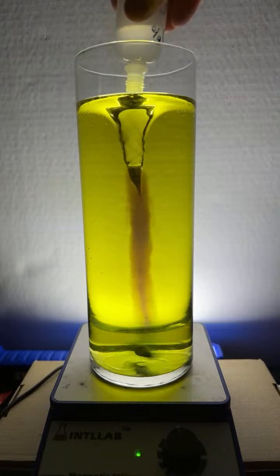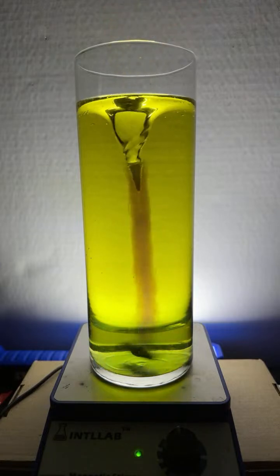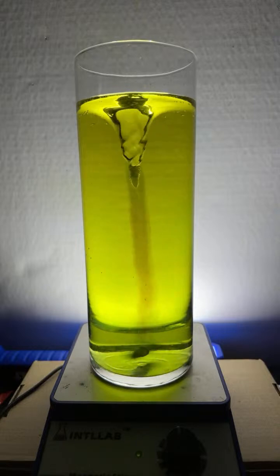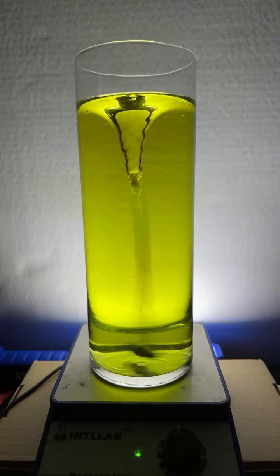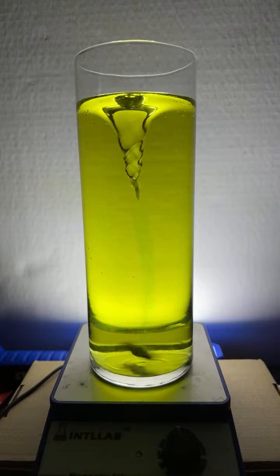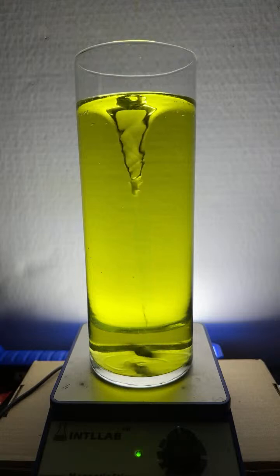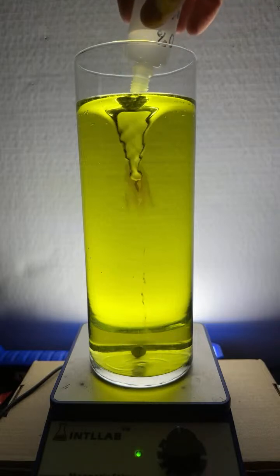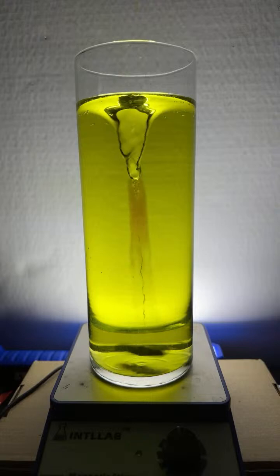See how they disappear? So what's happening is the carbon dioxide is reacting with the sodium hydroxide that I have added, and it's forming a salt that dissolves into the water. The gaseous form of the carbon dioxide is getting converted into a form where it dissolves in the water. And in that sense, we call sodium hydroxide a carbon dioxide scrubber.